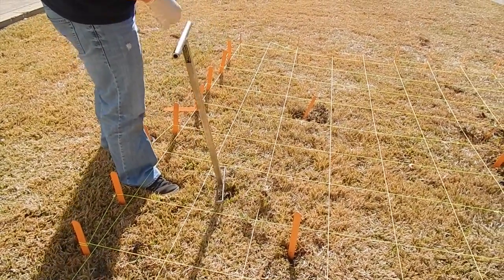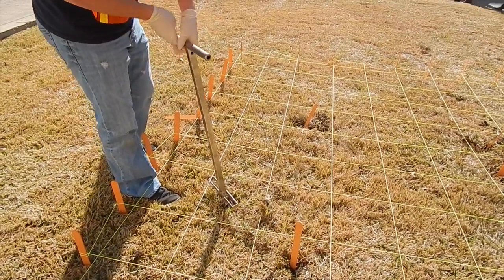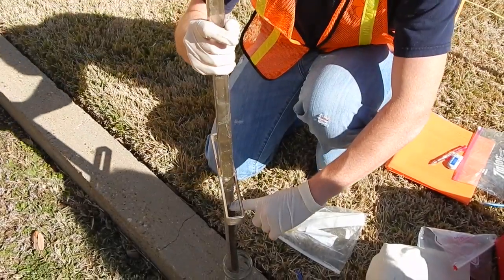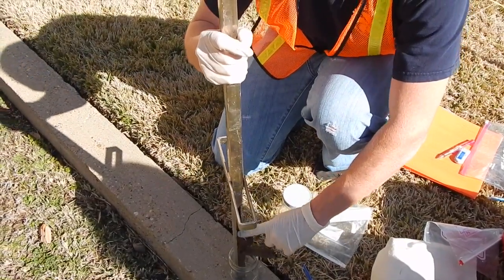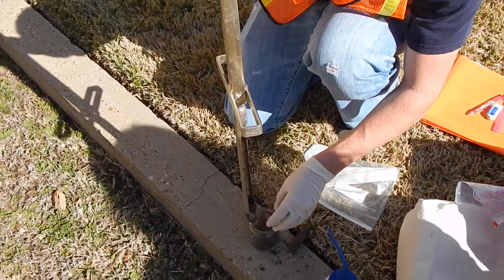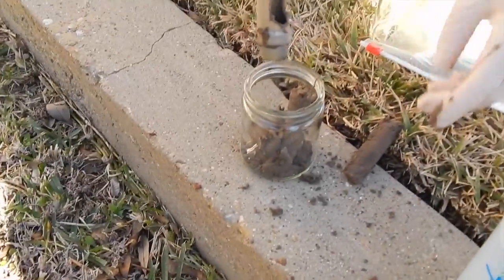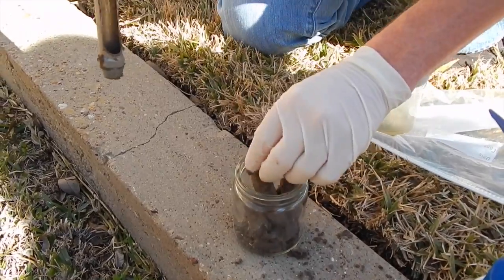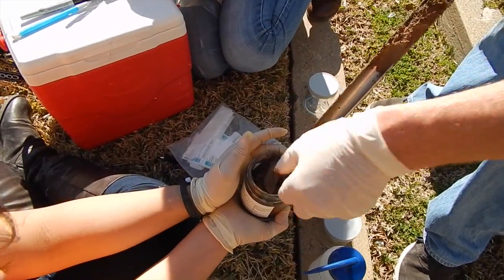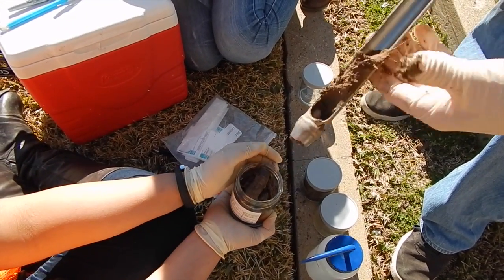Place the sample into a stainless steel, plastic, or other appropriate homogenization container and mix thoroughly to obtain a homogeneous sample representative of the entire sampling interval. Then either place the sample into appropriate labeled containers and secure the caps tightly, or if composite samples are to be collected, place a sample from another sampling interval into the homogenization container and mix thoroughly. When compositing is complete, place the sample into appropriate labeled containers and secure the caps tightly.